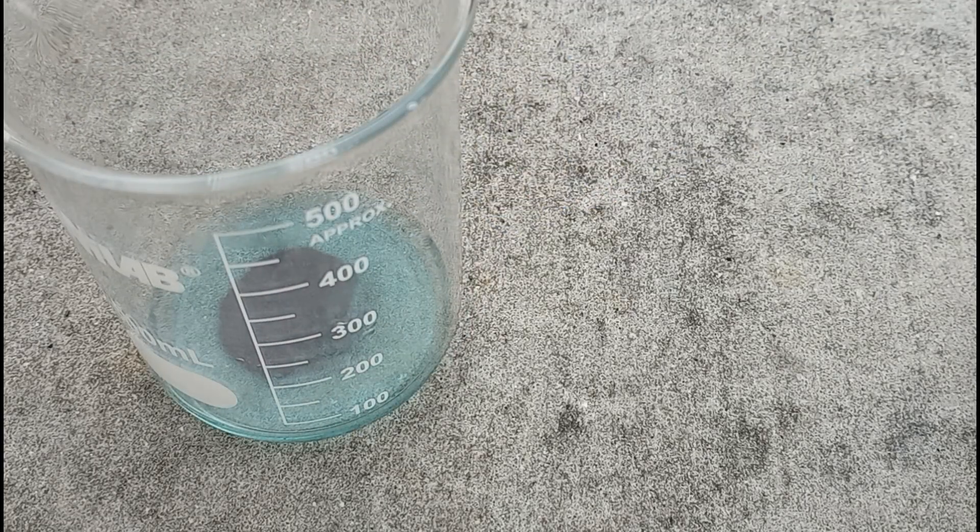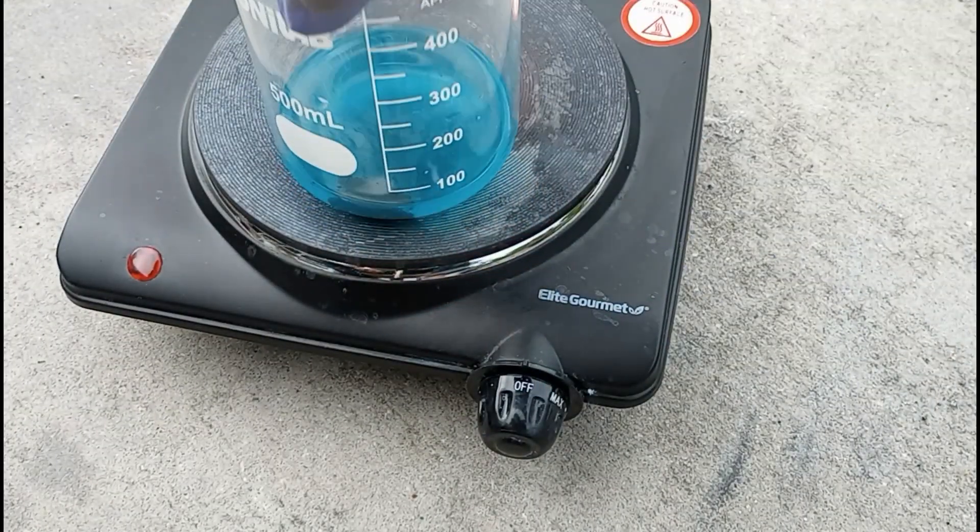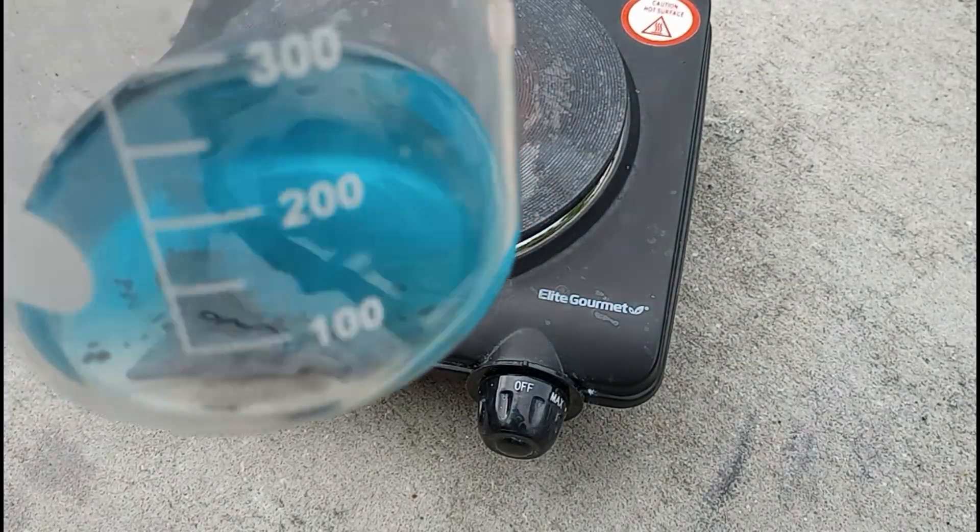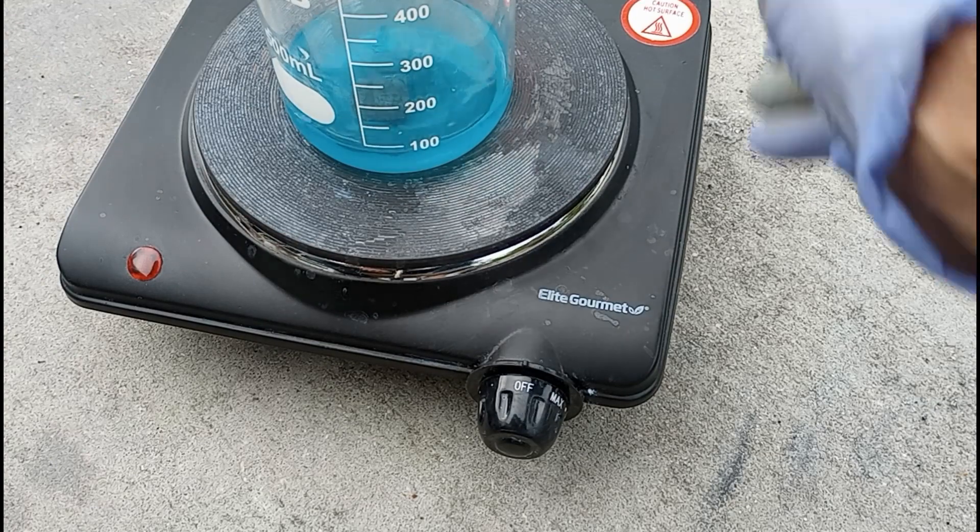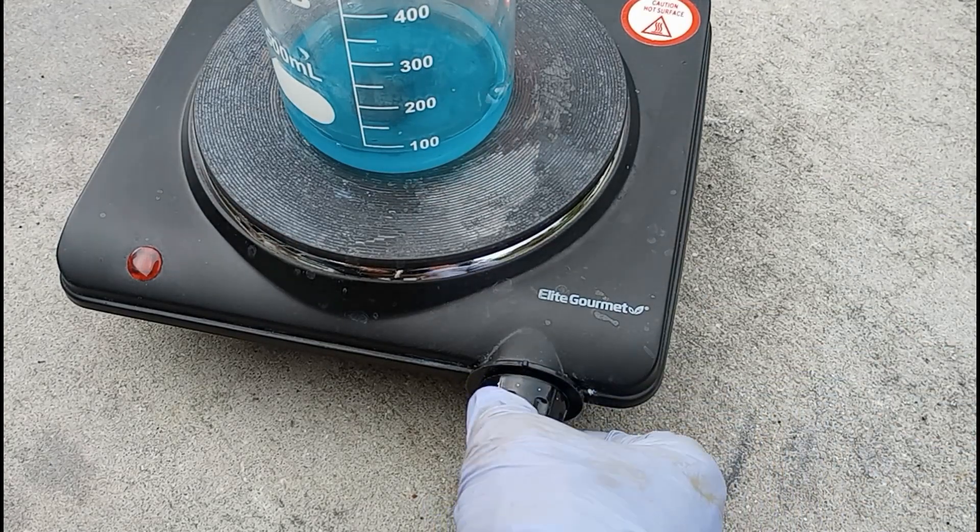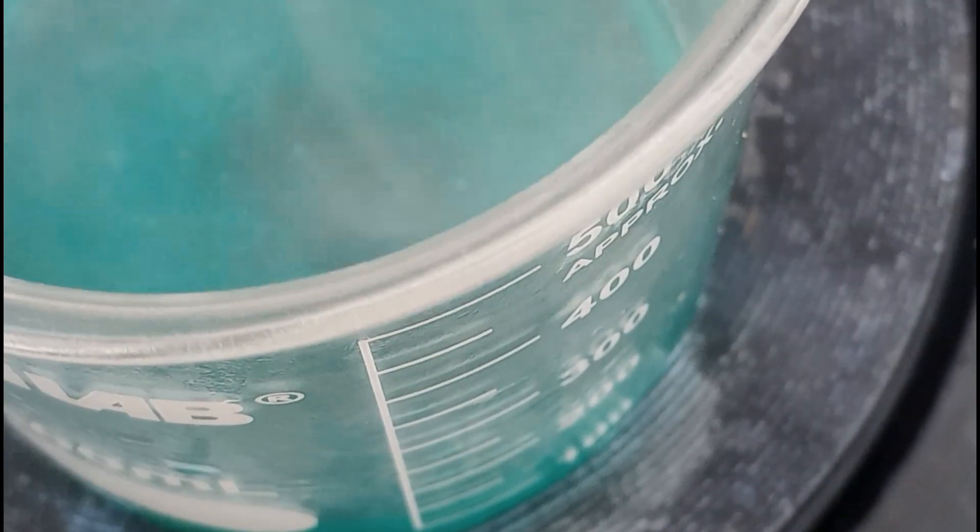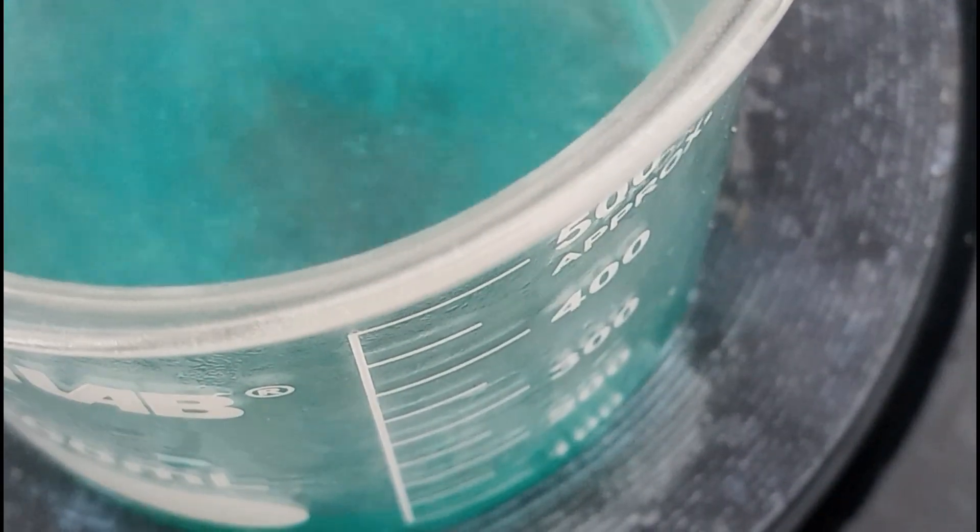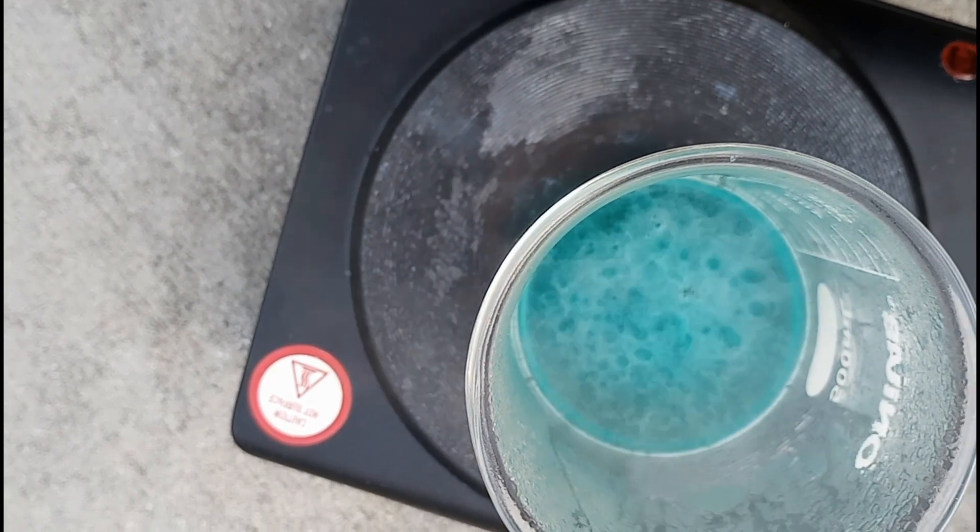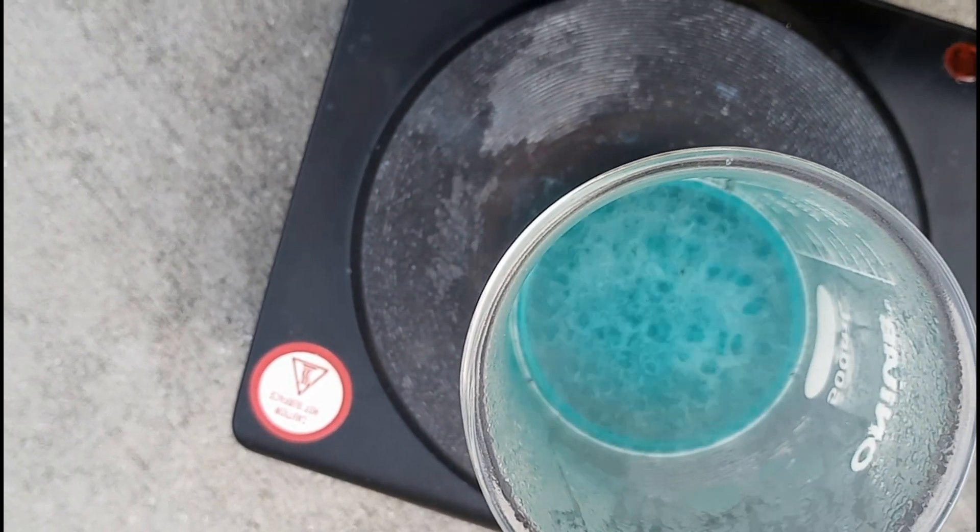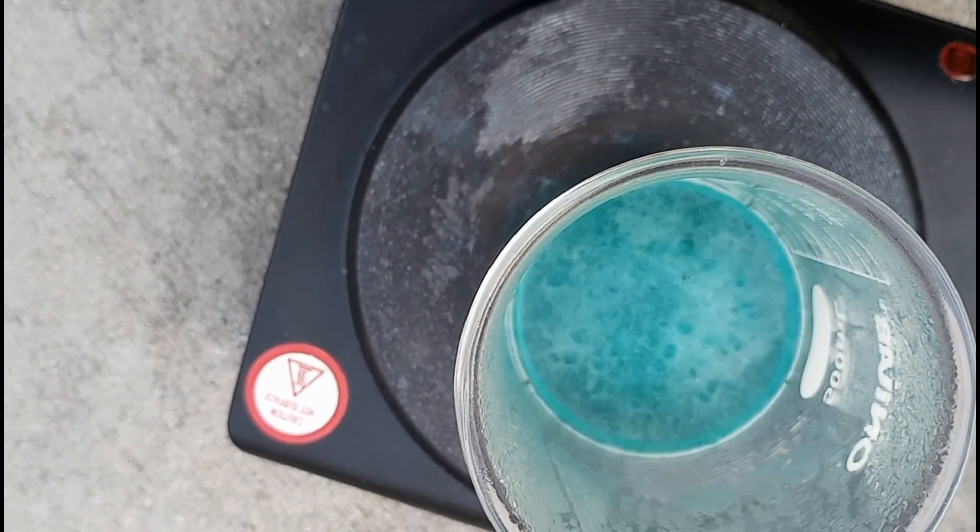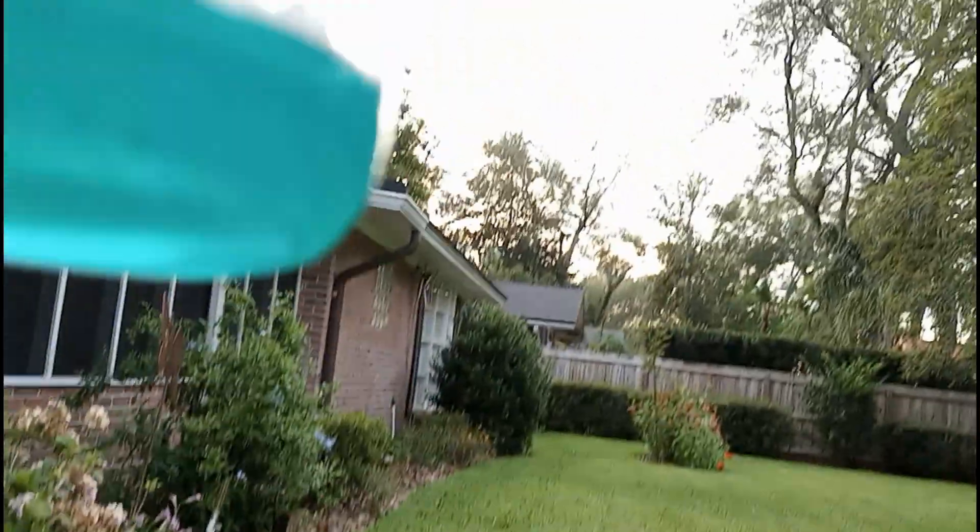It was getting dissolved, but not fast enough, so I had to break out the super scientific hotplate again. I turned it up to a moderate heat and got some reactions going. It looks like it's almost all dissolved, so whatever's left behind is probably some sort of impurity.